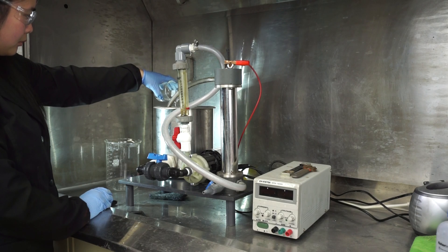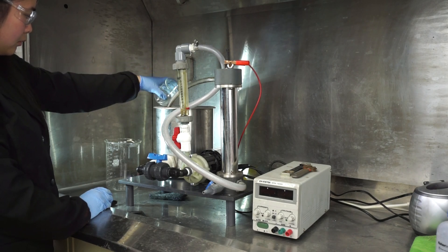This copper sulfate solution was prepared ahead of time and roughly 3 liters transferred to the feed tank.